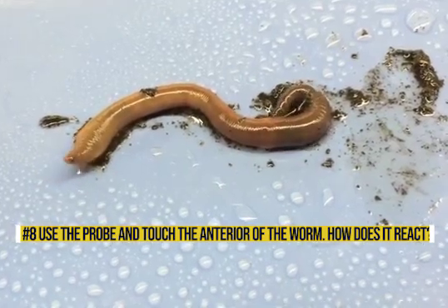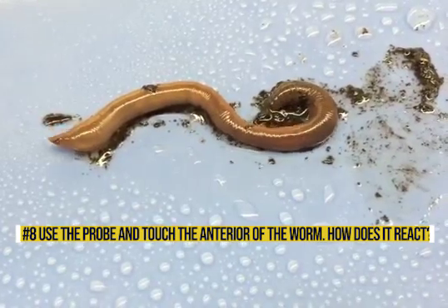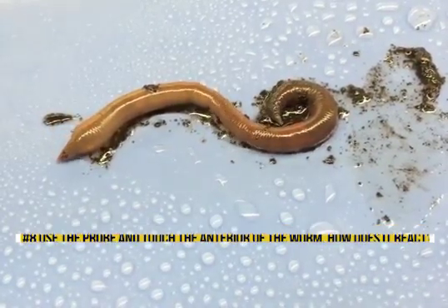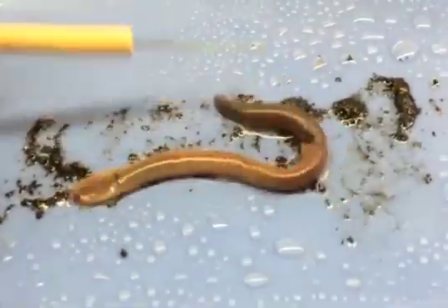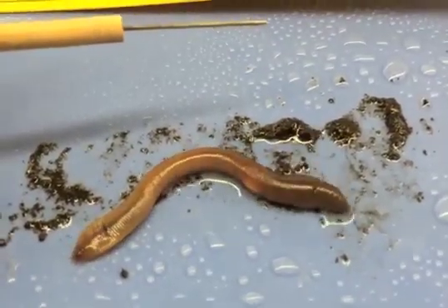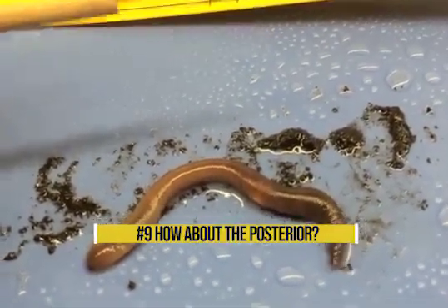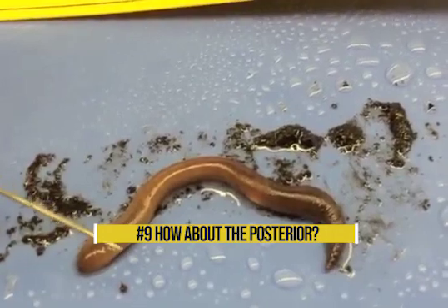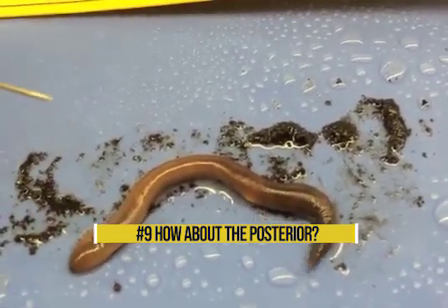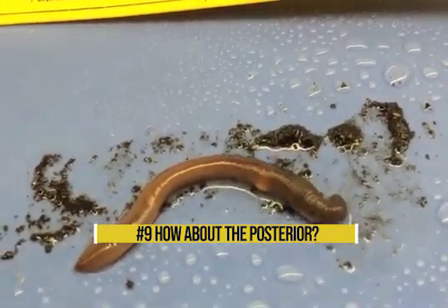Number eight: use a probe and touch the anterior part of the worm — how does it react? Record this data into your data table number one. How about the posterior? Record this into number nine on your data table number one.